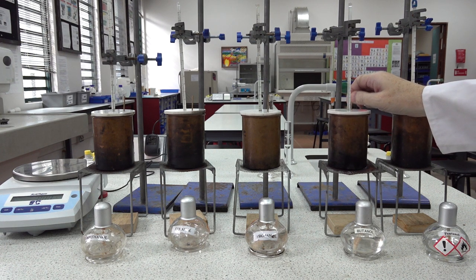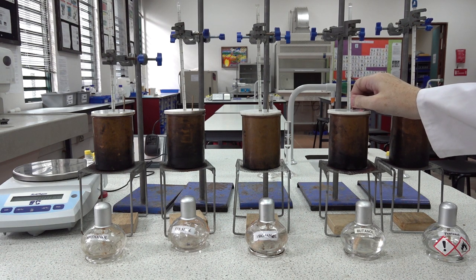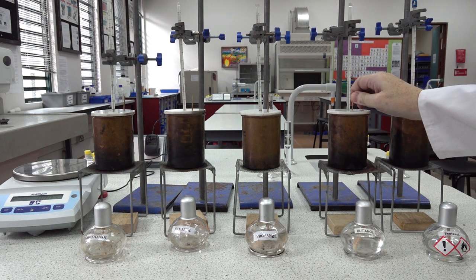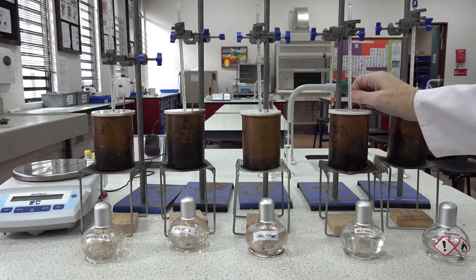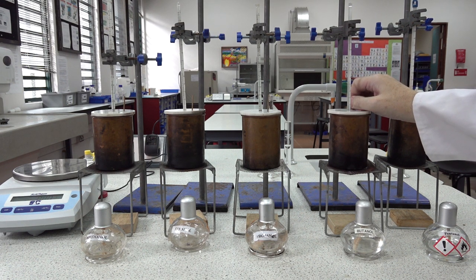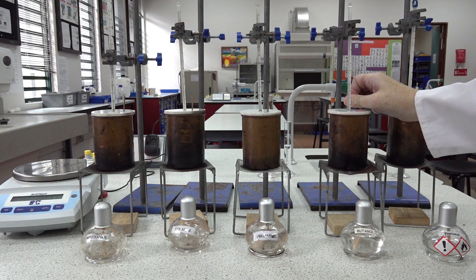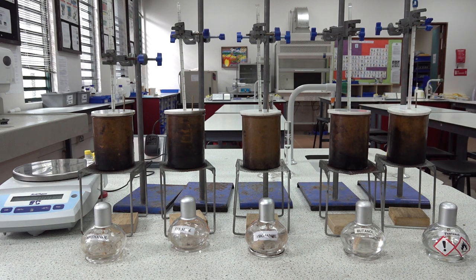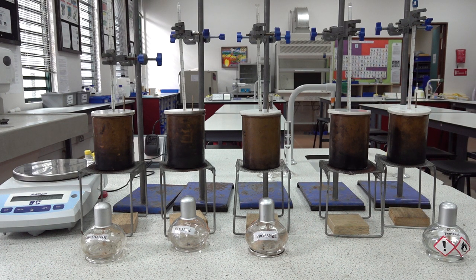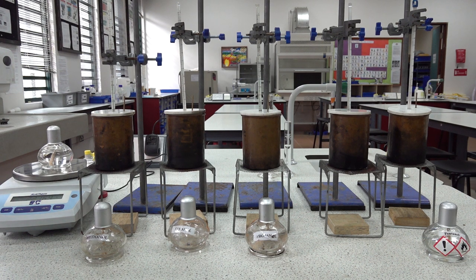Close to 35. Just about 35, I would say. Still close to 35. Not quite hitting 35.5, are we? Yes, 35.5. That's the maximum we're going to attain with the butanol. Let's take another mass reading. Mass reading at the end now is 221.69 grams for the butanol.